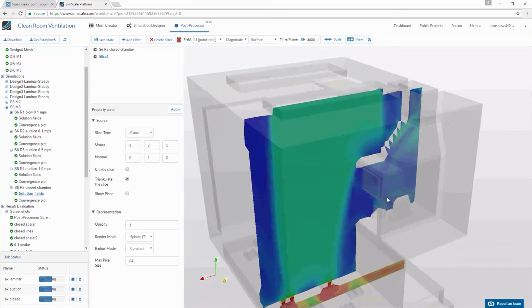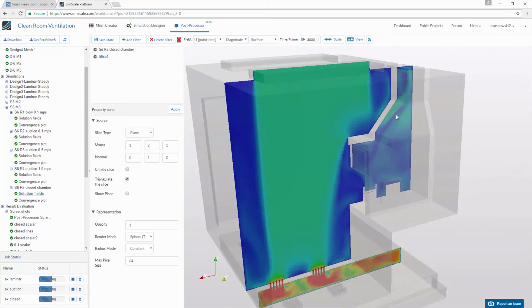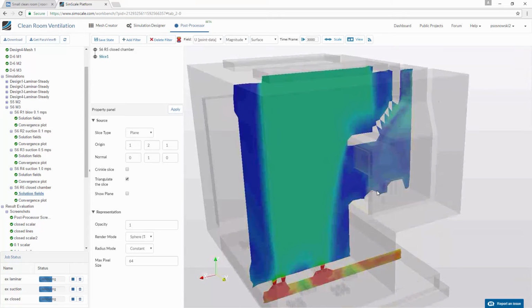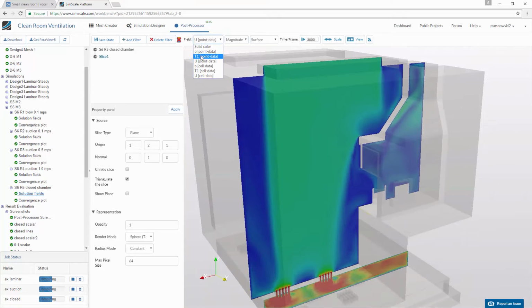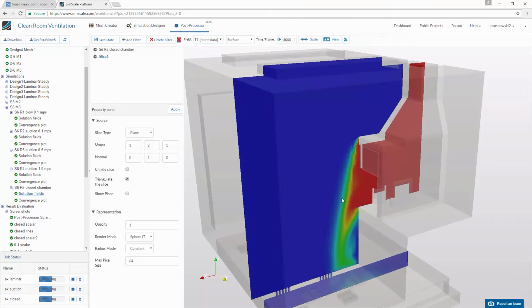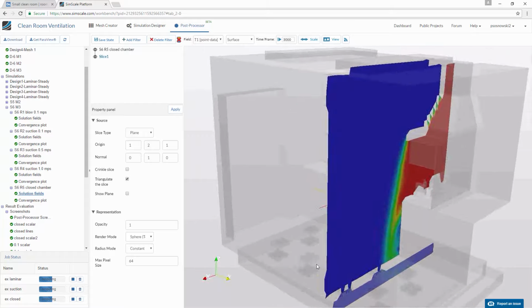At the same time, there's quite a lot of recirculation going on within our reaction chamber, simply induced by the inlets coming from our pots. They have to exit somewhere, and they are driving the flow. Now we'll visualize the contaminants themselves. And we can see that the whole chamber is basically completely filled with the contaminant, and it is being pushed out. Fortunately, it's being washed away and downwards towards the exit elements, the exit chamber.